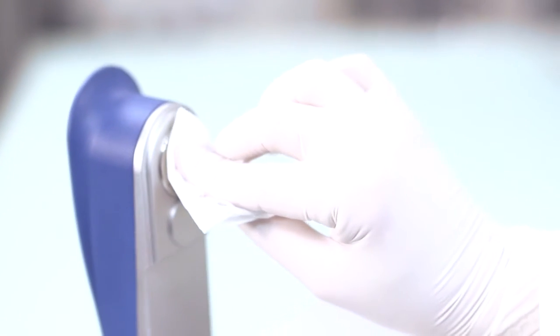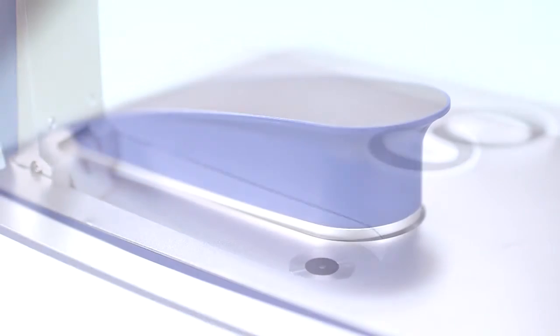Once the blank is clean from both the upper and lower platforms with the lint-free laboratory tissue, the sample can be measured.